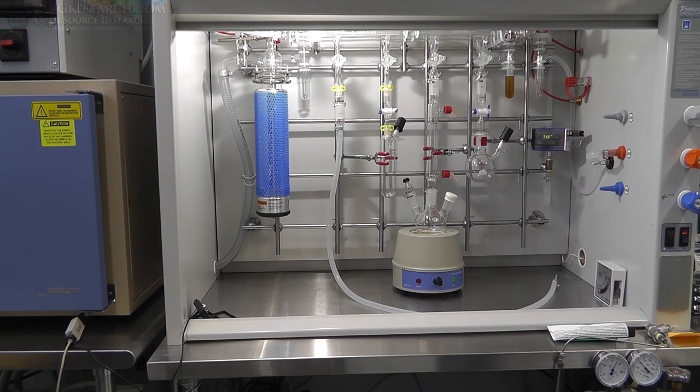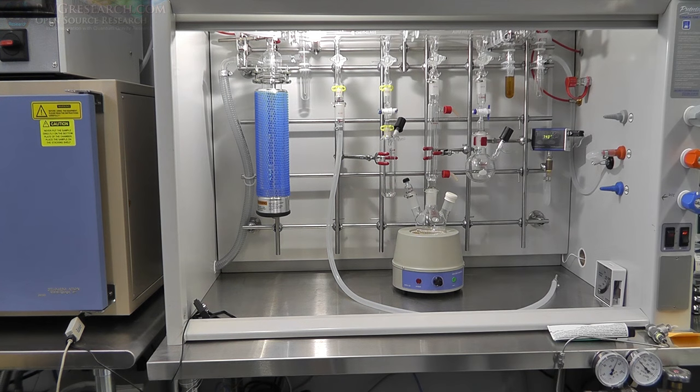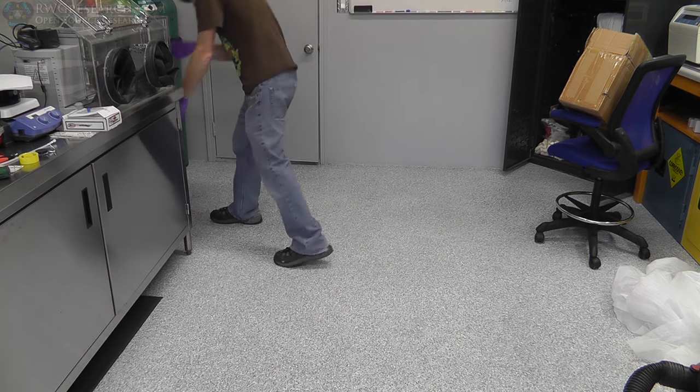And now you're actually cooling the trap. Now, I would actually have to make a bigger base plate here. This one's a bit small. But yeah. So now, where do we get liquid nitrogen from? Well, we get it from this thing.